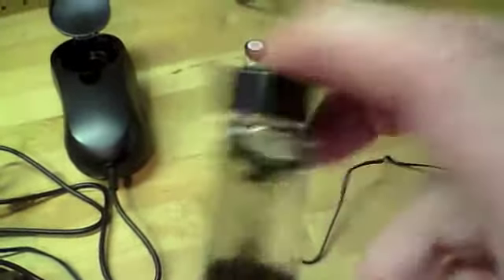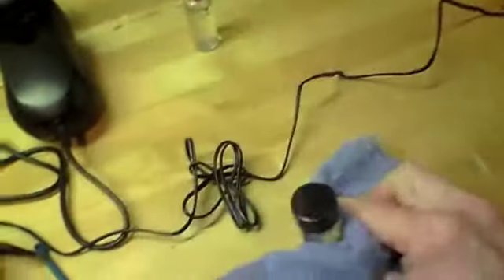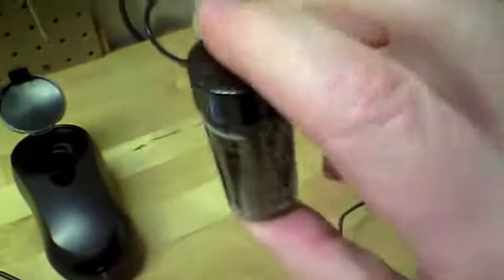So again, it tells you to use a lint-free cloth. This is not one. To wipe it off. I'll try my best to do that. I've already done it a little bit, so I think I'm okay. And then it tells me to invert this 4 times. 1. You don't want to shake it because you get all kinds of bubbles. And we don't want bubbles.